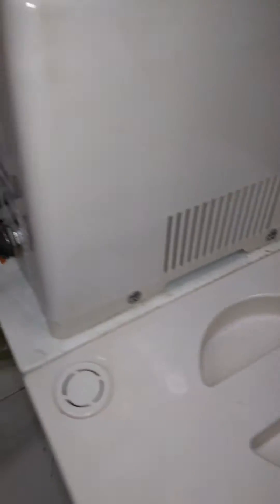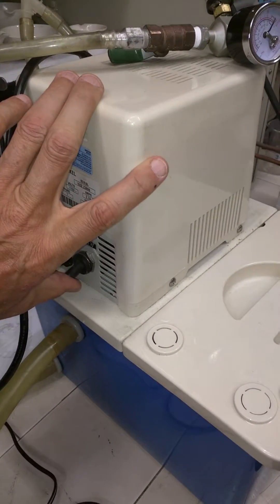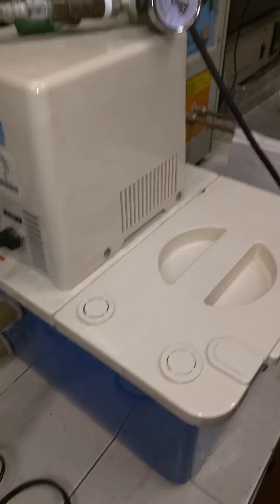I'm going to close the lid. I'm going to turn on the pump and then we'll see the vacuum it produces. Okay, so let's close the dial.